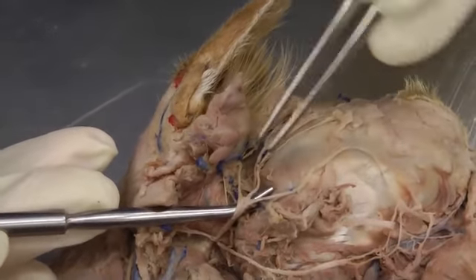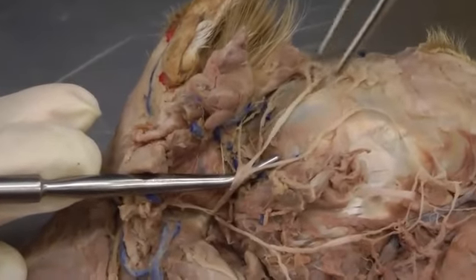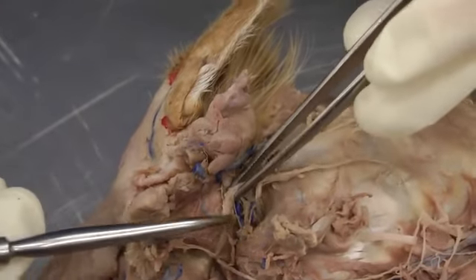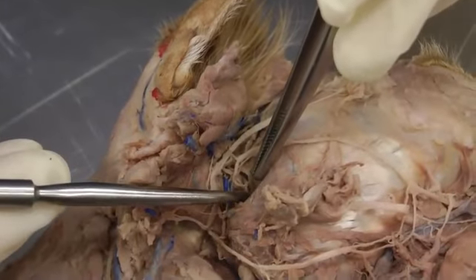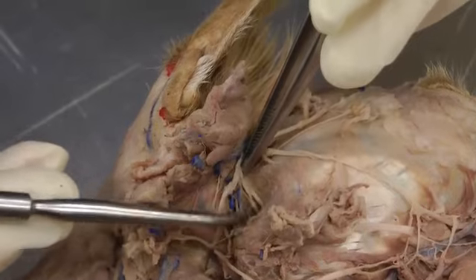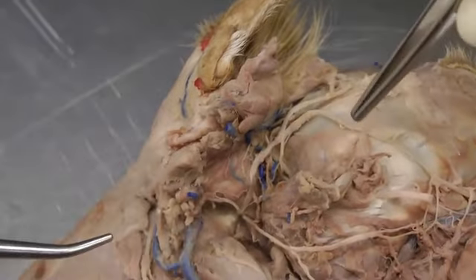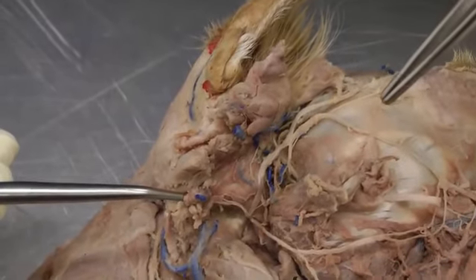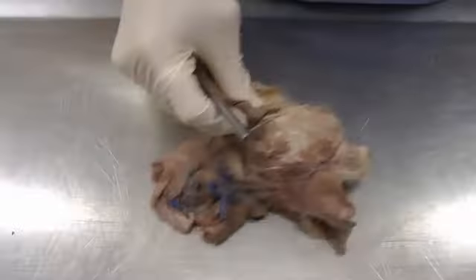And so you have rostral auricular branches going towards the ear, and then we have palpebral branches going up towards the eye. Then in the same field you may try and find your mandibular nerve. It's going to be just in front of the ear and deep, and there are these little nerves coming out just in front of where that facial nerve comes out. If you can find that, it's the auriculotemporal nerve, a branch off the mandibular. And then for our other parts of the mandibular, we're going to switch to the other head.